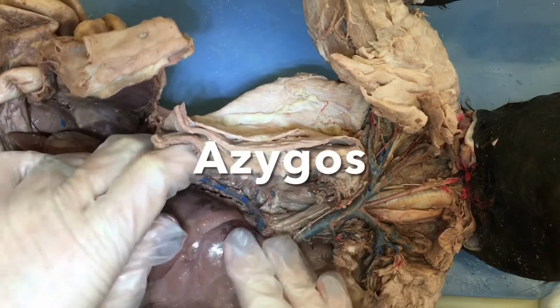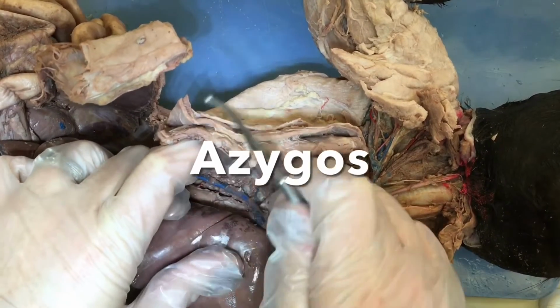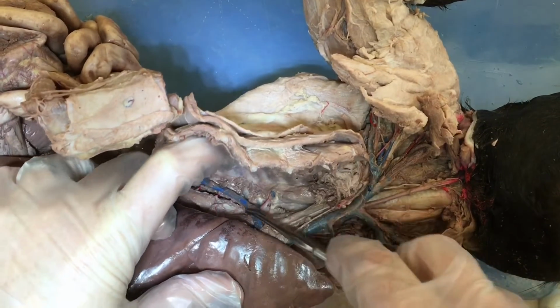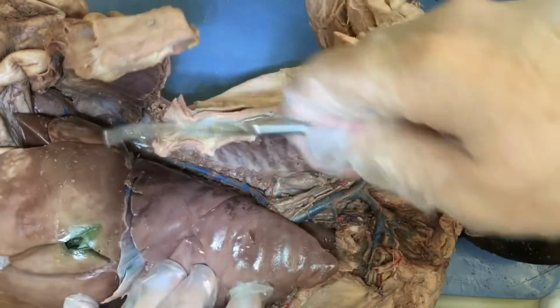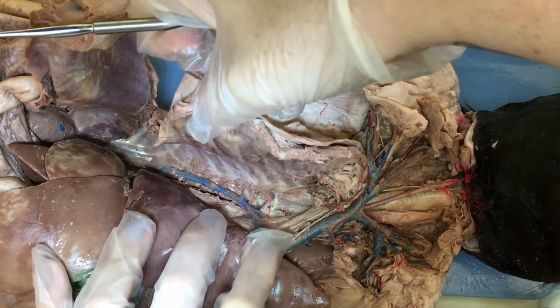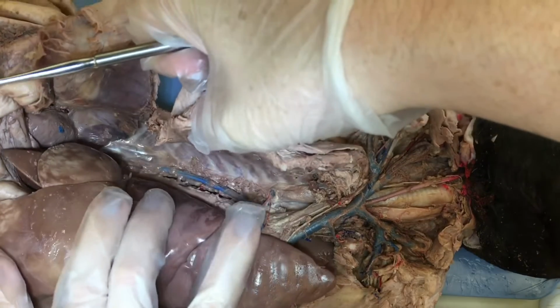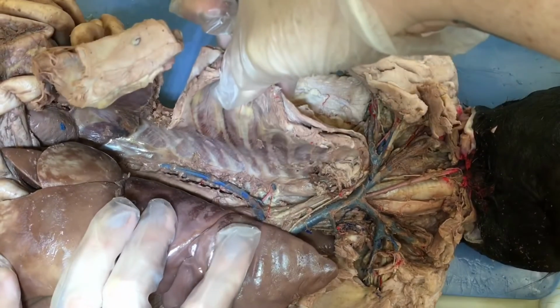All right, next we're going to look at the azygos vein. And the azygos vein is a branch off the vena cava. And you can see the thoracic veins are draining into the azygos vein. And it's on the right side of the cat. So there's a lung and a liver that I'm moving aside here. And it runs parallel to the vertebral column. And that's the azygos vein on the right side of the cat.